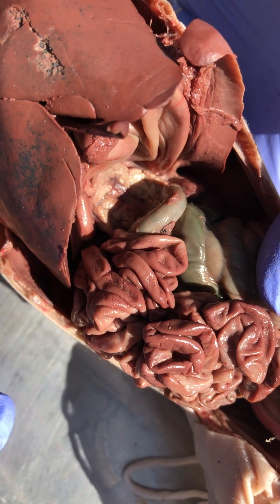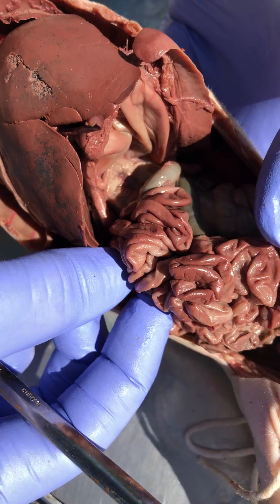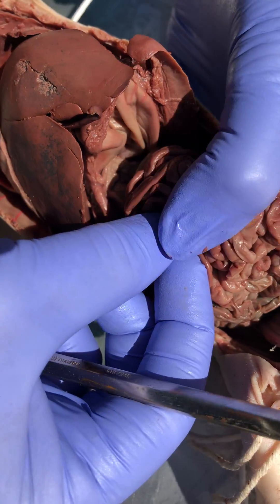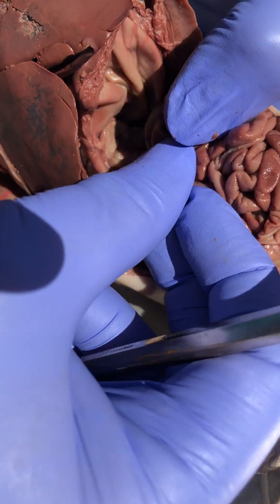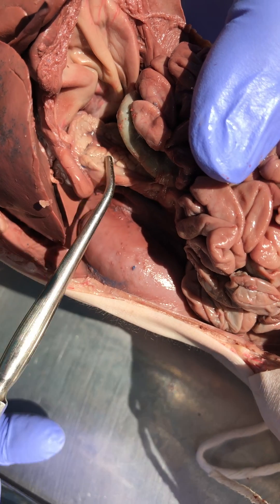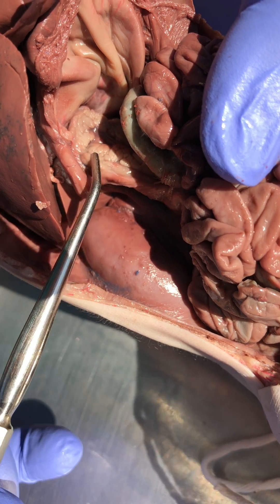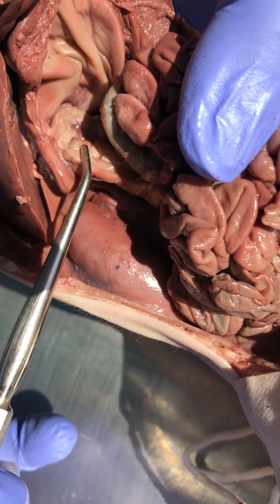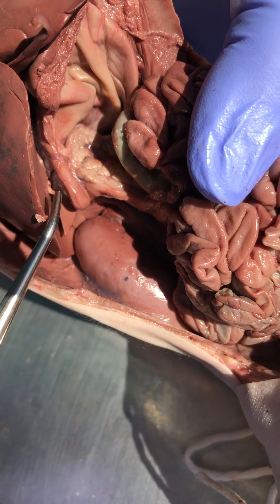Now notice if I roll over these tubes — we're going to learn those in the digestive system — you've got a lot more pancreas. That's the ventral lobe. So you're going to have two lobes: ventral lobe and dorsal lobe.